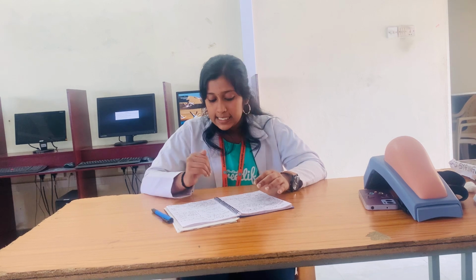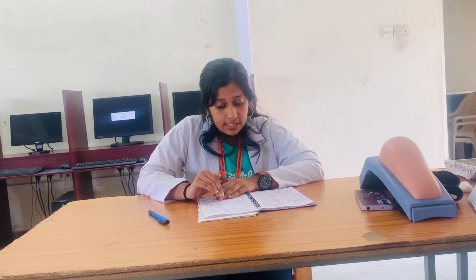Then an example of a study conducted is the analgesic study. There is the tail flick method, which is also known as the tail flip method, and we also have the hot plate method. Here there are 6 rats per group and there are 4 groups: control, standard, low dose test compound and high dose test compound. So there are a total of 24 rats here. The number of rats is fixed according to the guidelines. So this is what happens during an animal study proposal, and what happens in an animal house has already been discussed. So thank you.